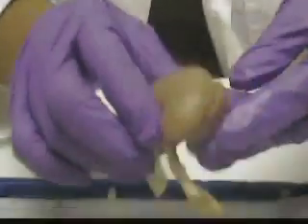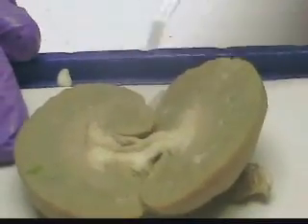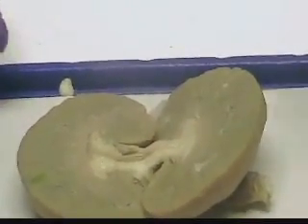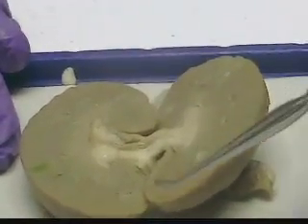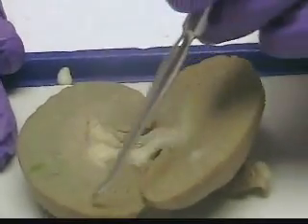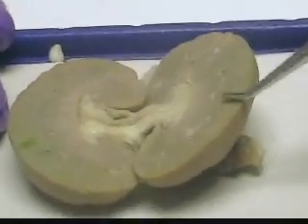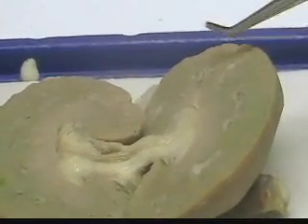Okay. Now when you open up the kidney, you're able to view the internal structures. Now this kidney has not been injected with latex, therefore a lot of the structures look the same color, but I'm going to point out the regions. If you look at this area here, this is known as the cortex. That's the outer region, the cortex. And this region is very vascular. And also you have a plethora of nephrons.